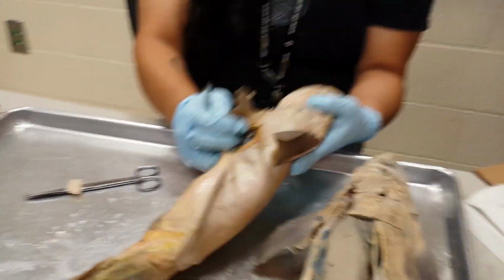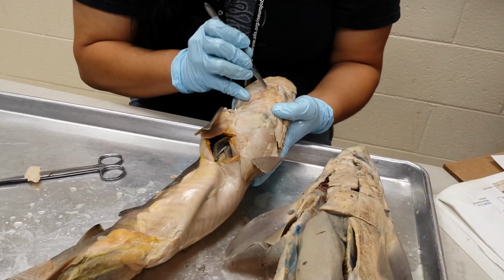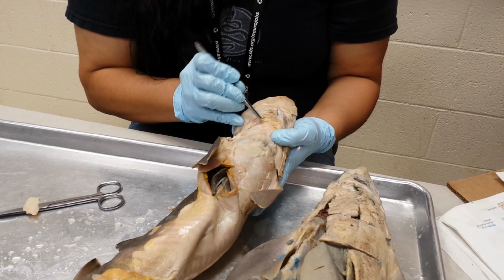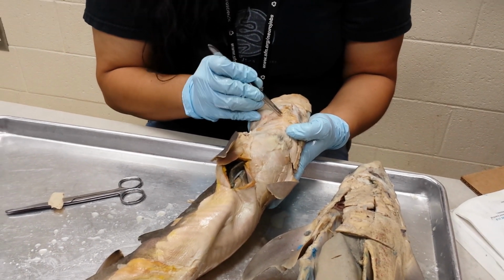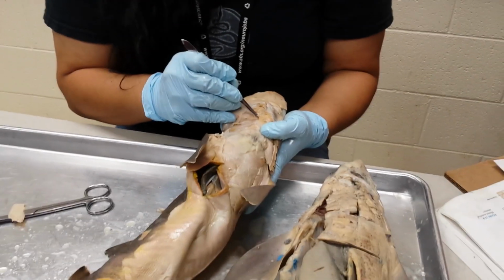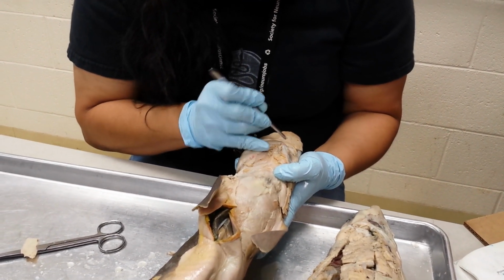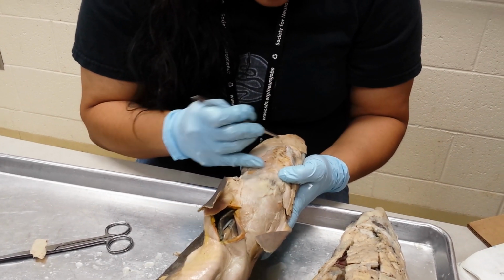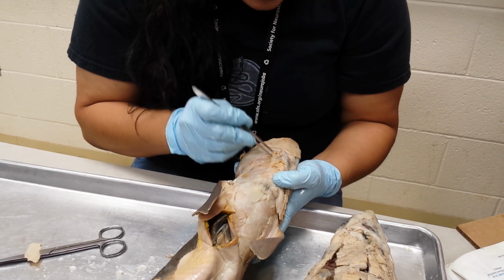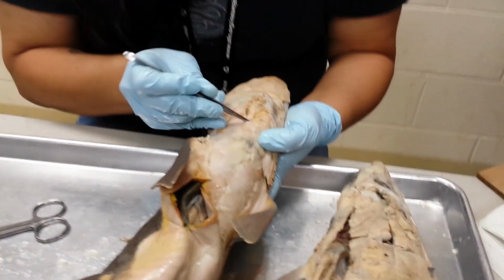So anyway, what you want to do is start picking at this muscle, the intermandibularis, from lateral to the midline. The reason that we're going to pick at it kind of messily is because there is a muscle that runs fairly superficial and just underneath the intermandibularis. I know that's messy, but I'll show you what you need to know.